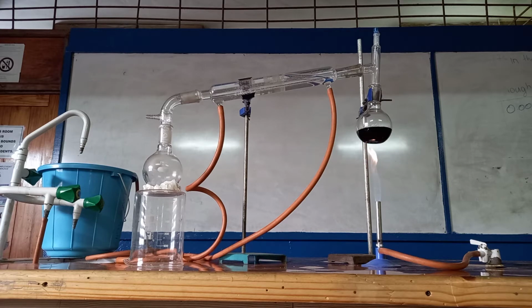In this video, we are looking at the oxidation of alcohols again, but this time we're actually going to collect the product. So we know that when we oxidize an alcohol, we get a carboxylic acid. But unlike in the previous video, where we did it in a test tube, so more than one thing would have been present, this time we're going to collect our aldehyde.